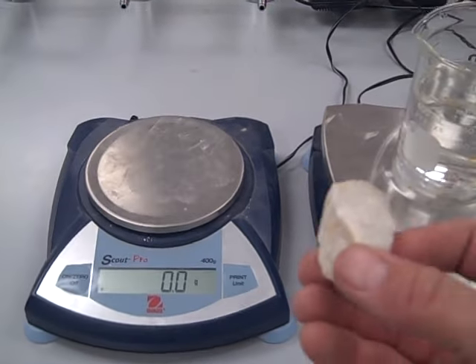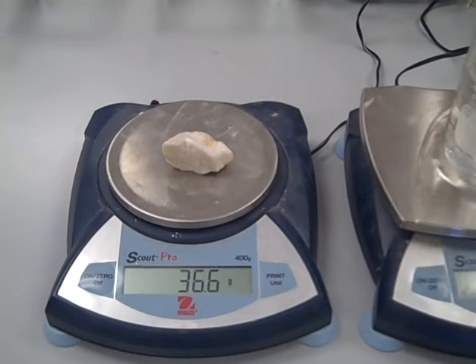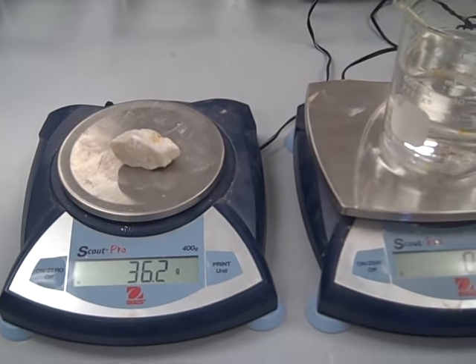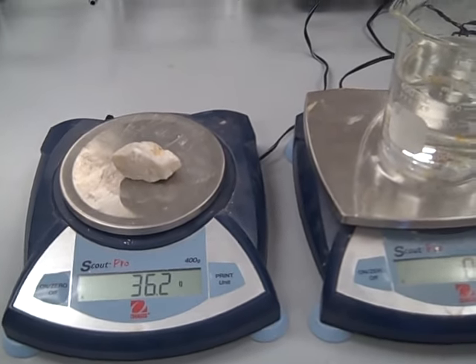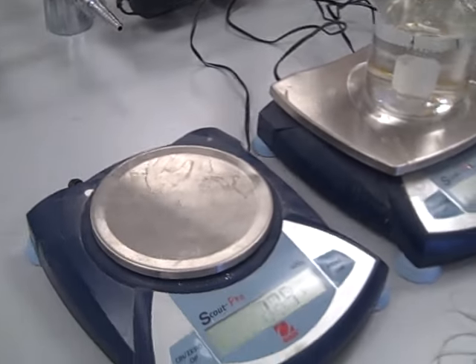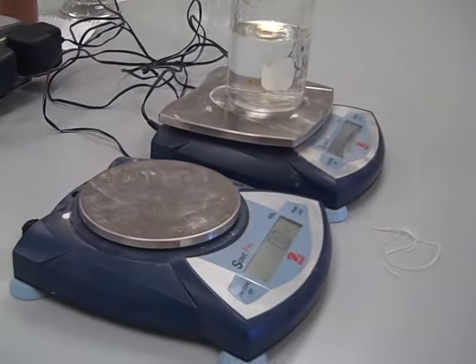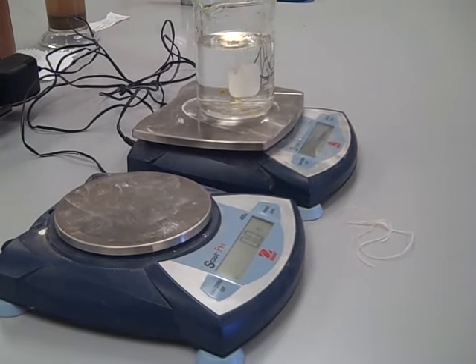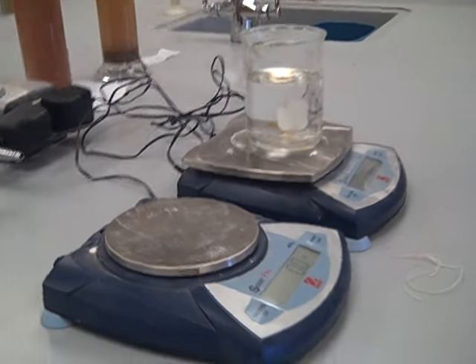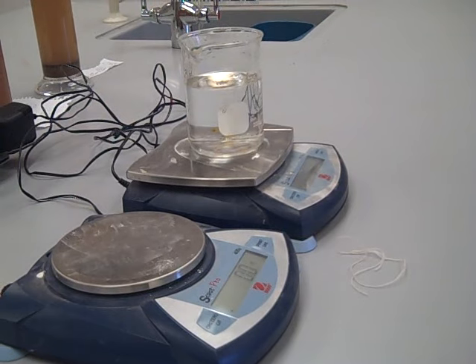We'll first find the mass of this rock, which is 36.2 grams. But to find the density we also need the volume, so we're going to use a displacement method here to determine the volume of our rock, because mass divided by volume is equal to density.